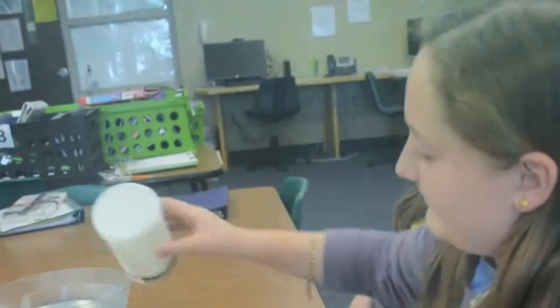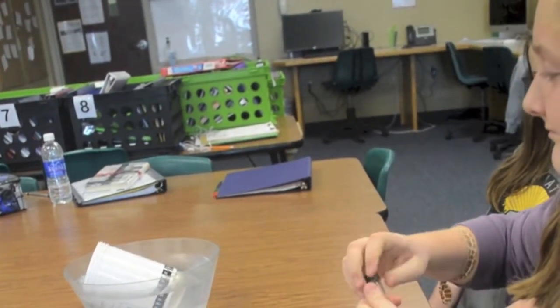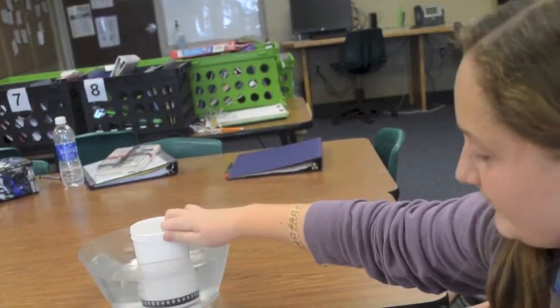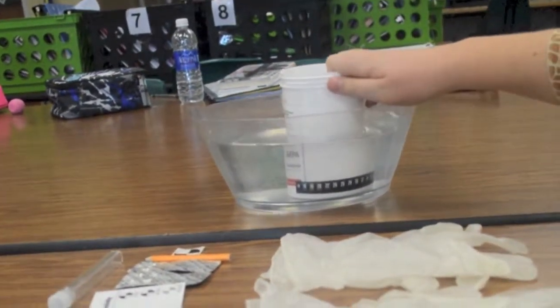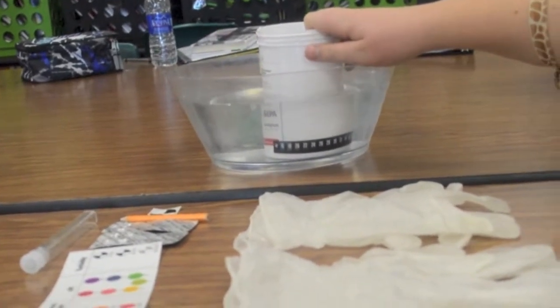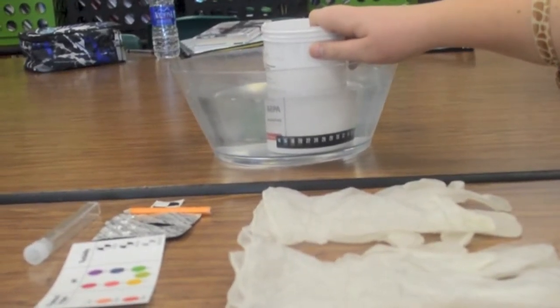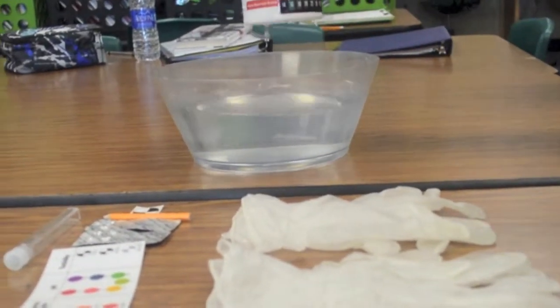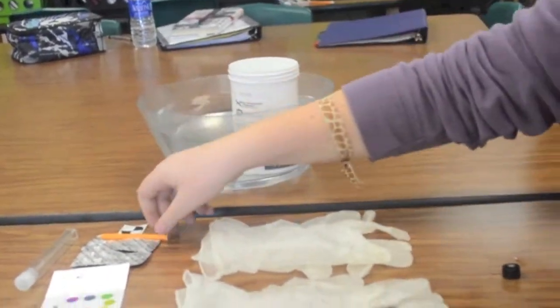The dissolved oxygen procedure. Record the temperature of the water for your DO to see. Remember, leave it in there for a minute. The number with the green/brown background is the temperature. Record it in Celsius.